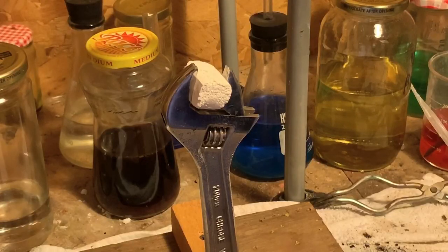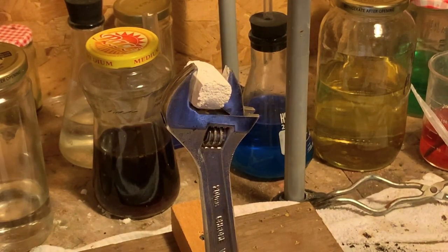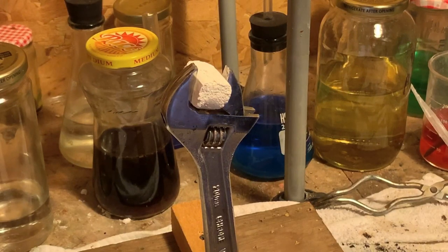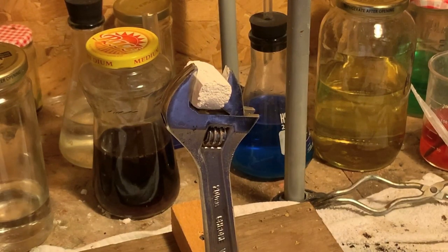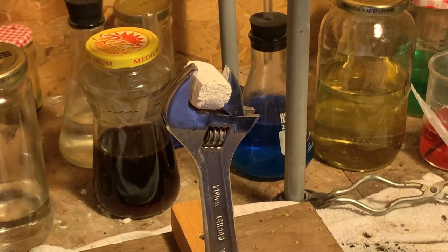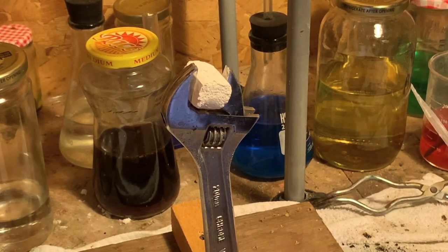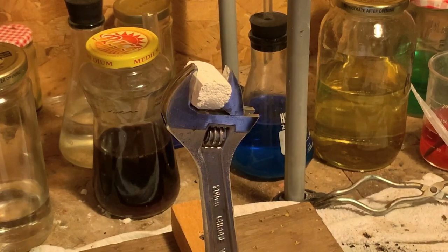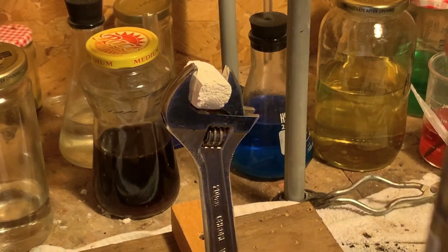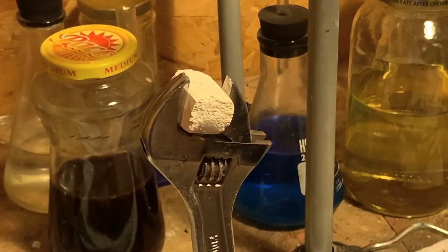What you see here is the calcium oxide or lime. To create this limelight effect, it's best to use an oxy-hydrogen torch because the torch flame itself is nearly invisible. But in this video I'm going to be using a propane torch to heat our material. Propane burns at a higher temperature than butane.